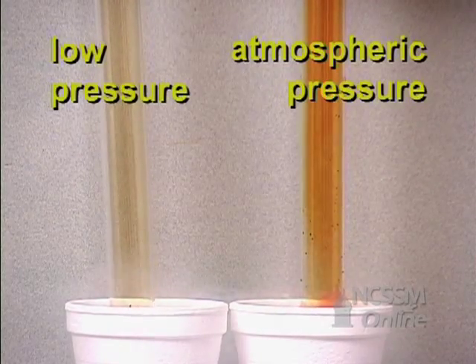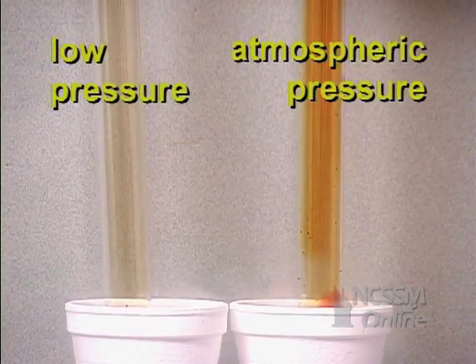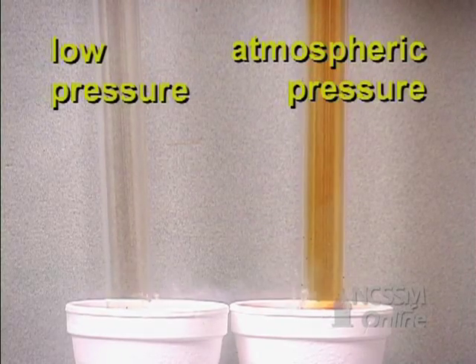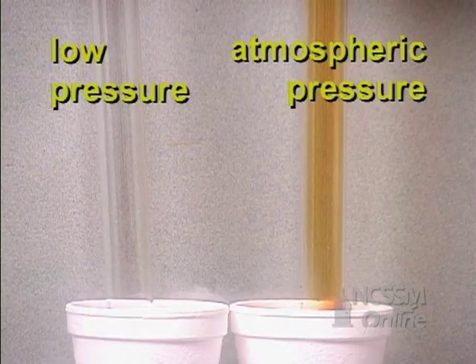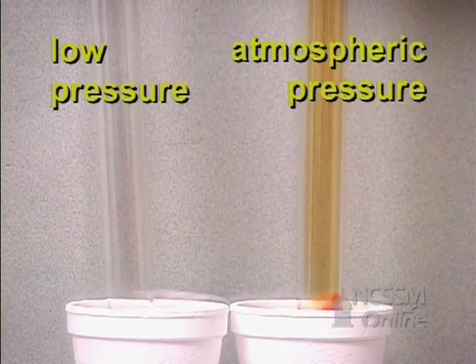As the tubes go into the liquid nitrogen, the bromine vapor condenses. The bromine in the low pressure tube condenses more rapidly than the bromine in the atmospheric pressure tube.